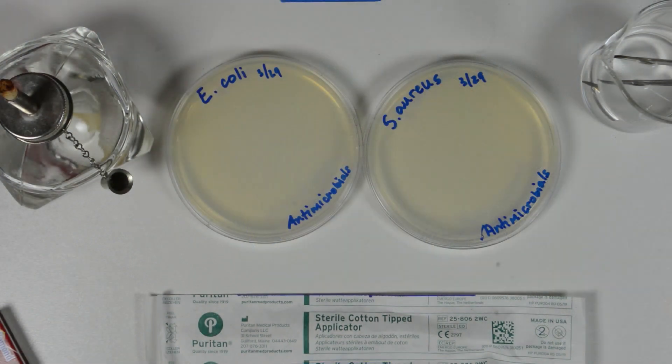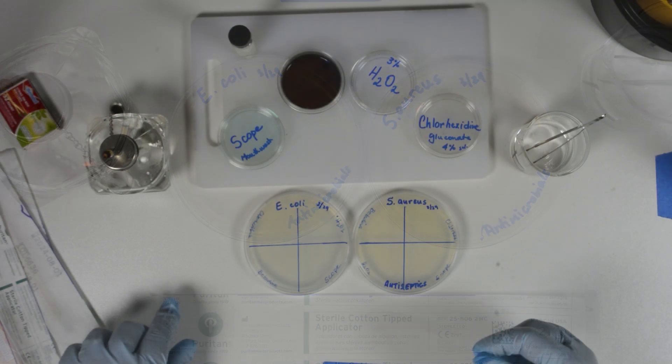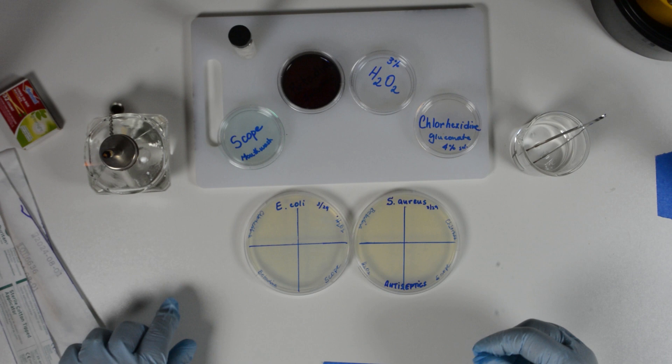We prepared two plates with E. coli and two plates with Staph aureus. One pair of plates, E. coli and Staph aureus, was used for disinfectants and the other pair was used for antiseptics.